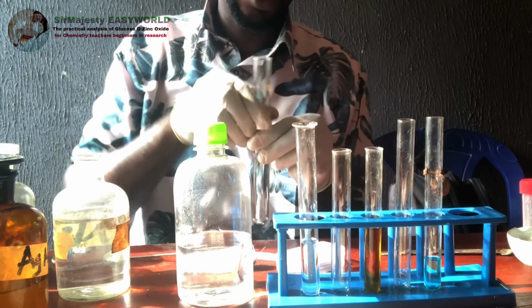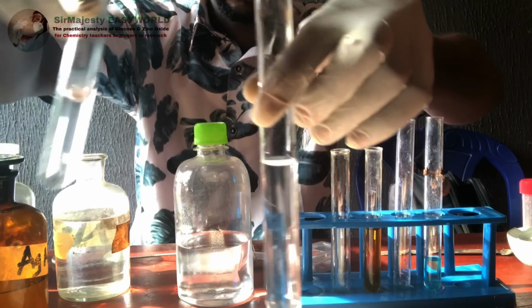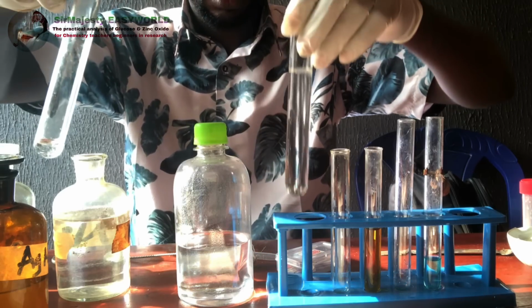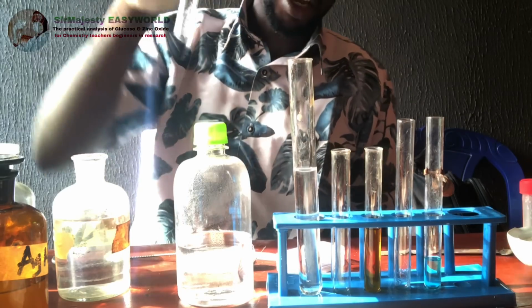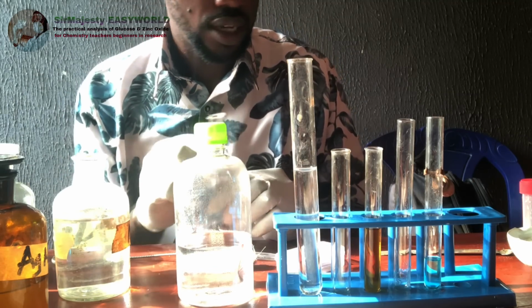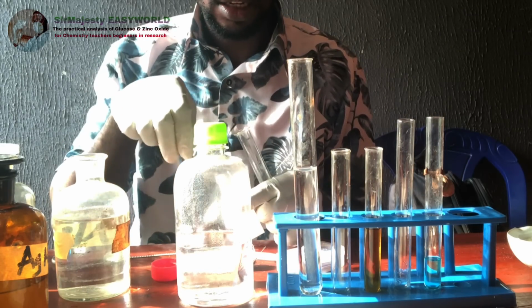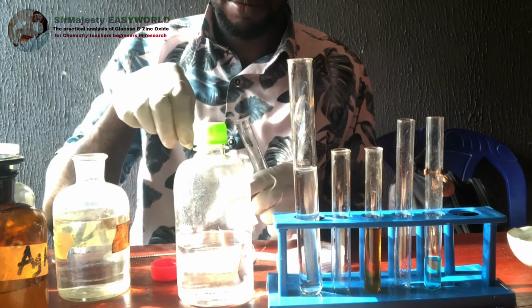So the next thing is to add the sample. This is the reducing agent, the glucose, which is an alkanal, into this, and keep. So you will start noticing, that's why I say exam bodies might not ask this, because it will take time for this reaction to occur, and the time taken might not allow it in an exam. But in real analysis, if you allow this on standing, without adding more glucose, I've exhausted the glucose solution I have made, so maybe I'll make another one.